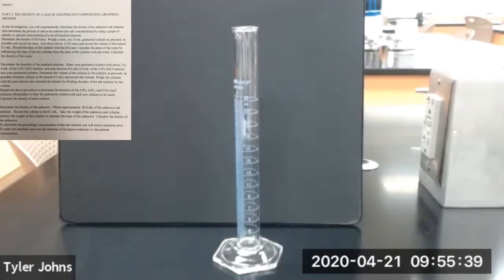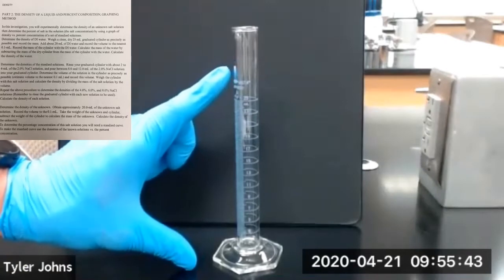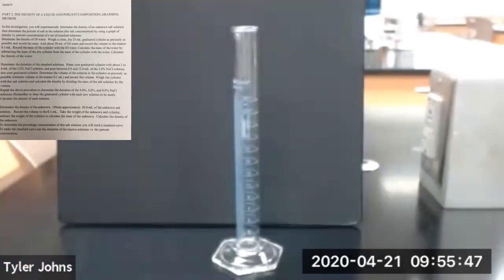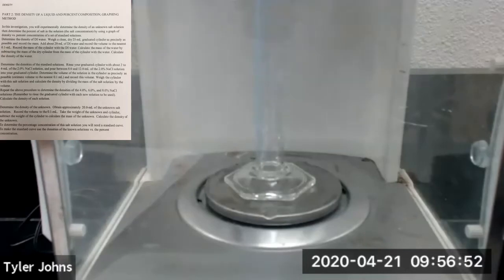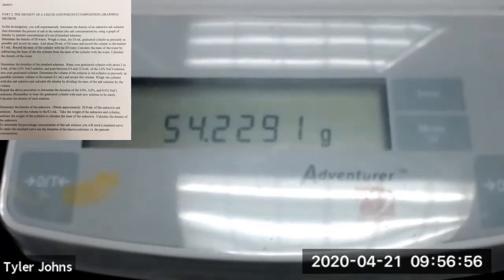To begin this experiment, we first need to take a 25 ml graduated cylinder, and we're going to determine the mass of this cylinder. The mass of our 25 ml graduated cylinder is 54.2291 grams.